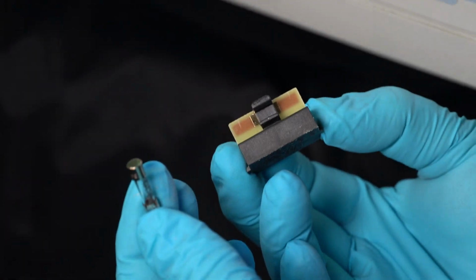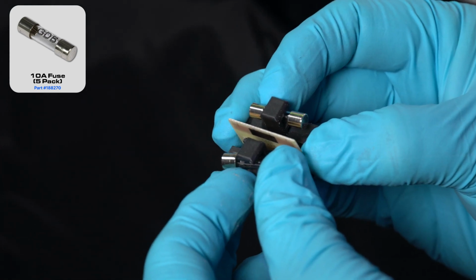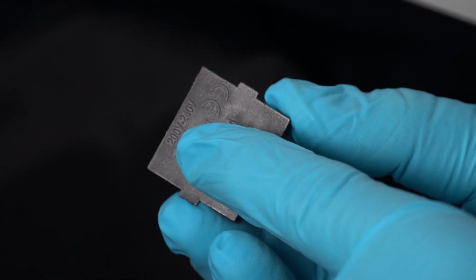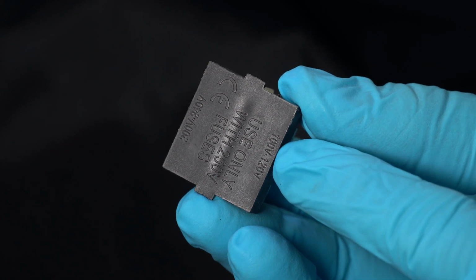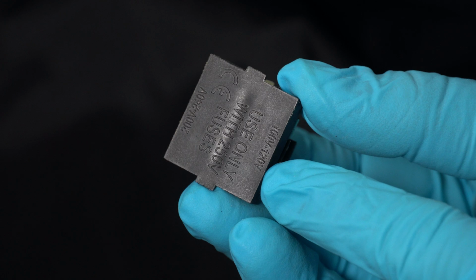Inside are two 10 amp fuses rated at 250 volts AC. The fuse holder has both a 100 to 120 volt and a 200 to 240 volt rating. So no matter where in the world you are located, this instrument can accommodate your power needs.